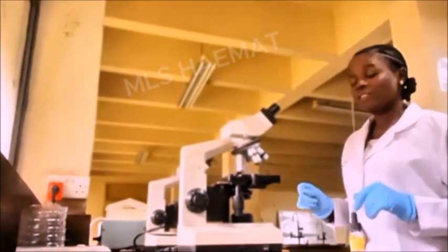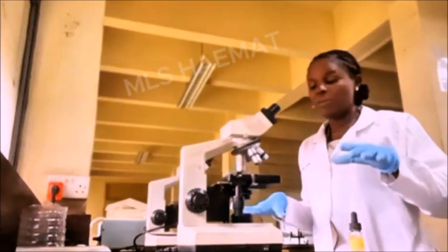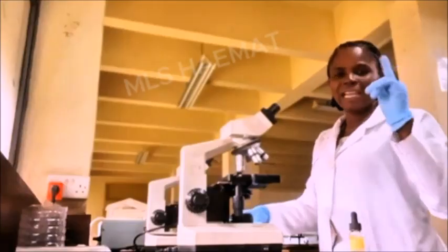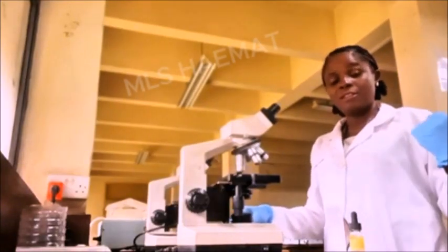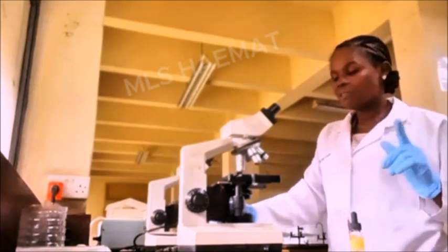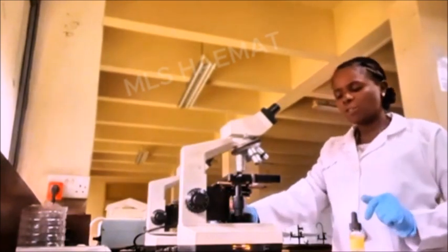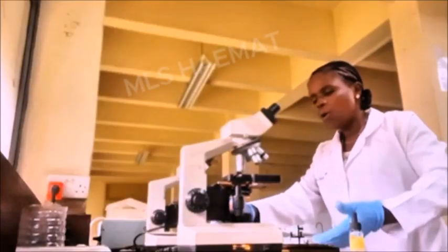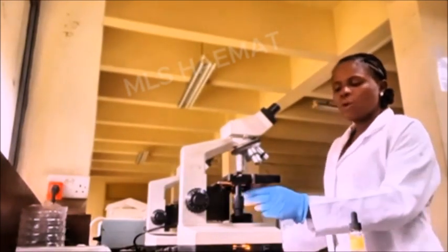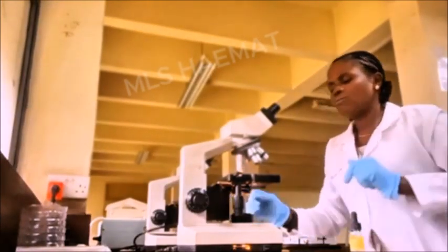In the case of focusing with the oil immersion objective lens, you need to use more light, unlike in the case of wet prep where you have to reduce the light. This time around, I'm going to increase the light. So I'll put on the illuminator. I'll raise the condenser, which is what I just did now. And then I will open the iris diaphragm. Now you can see that we have more light here.